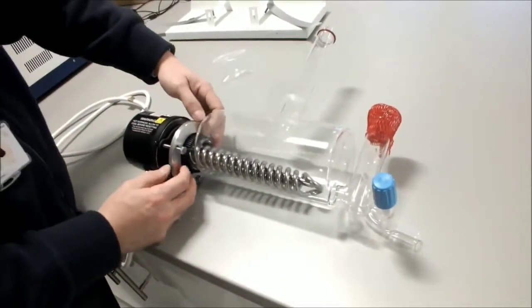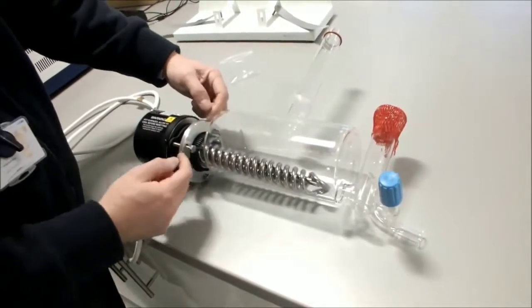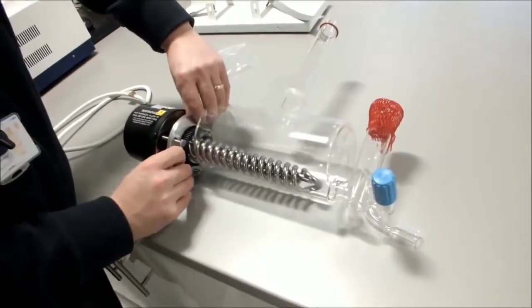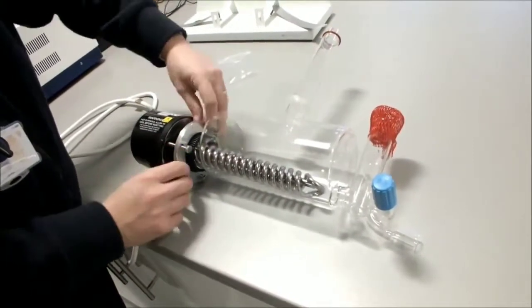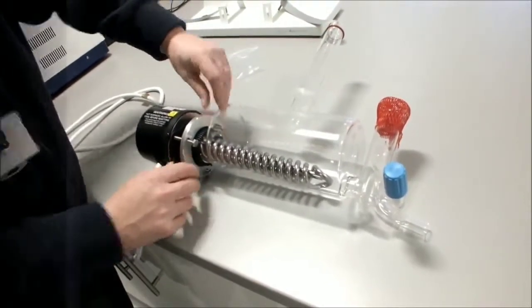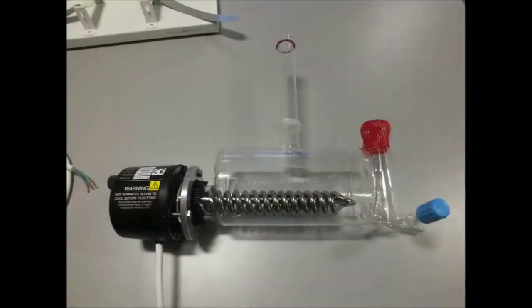When doing up the screws, it's important that you tighten the screws equally and the flange and the plastic against it is kept to the front of the boiler.